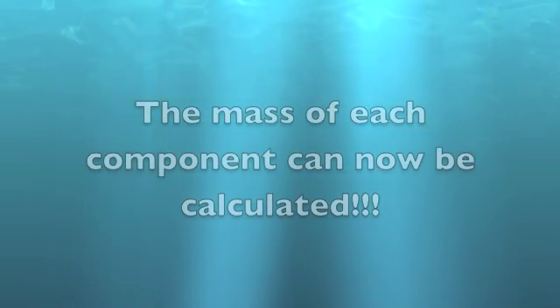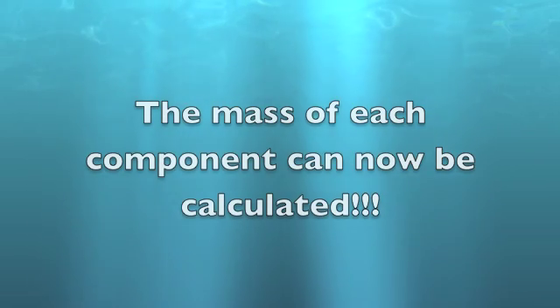Once everything is dried, you can easily find the mass of each of your components as well as the percent recovery and the percent composition.